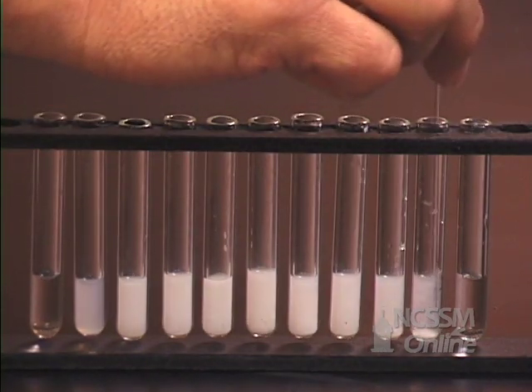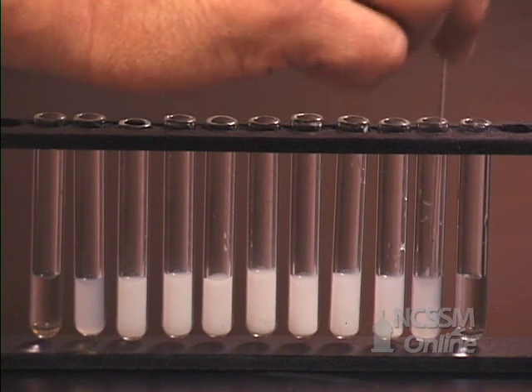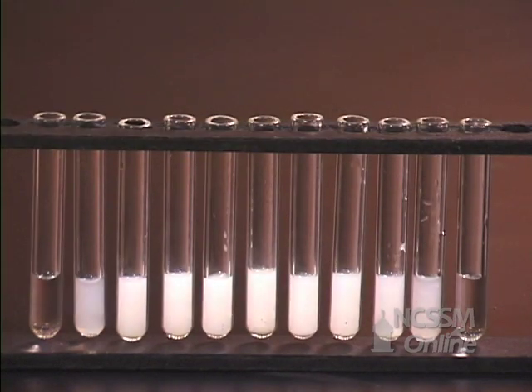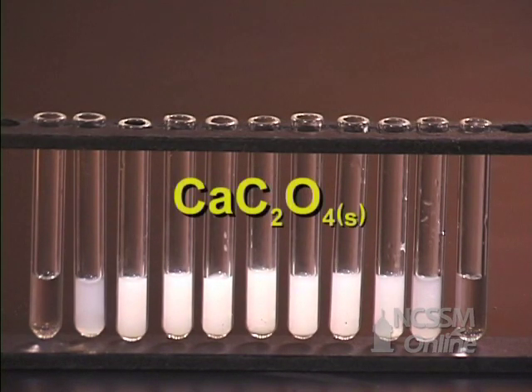We will thoroughly mix the calcium chloride and sodium oxalate in each tube. We will then let the tubes stand and measure the height of the solid in each of the tubes.